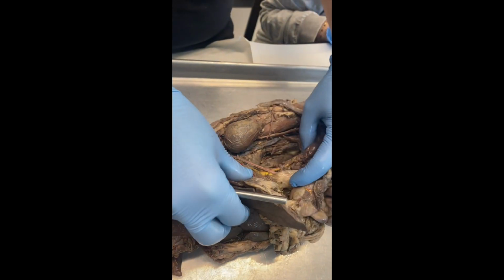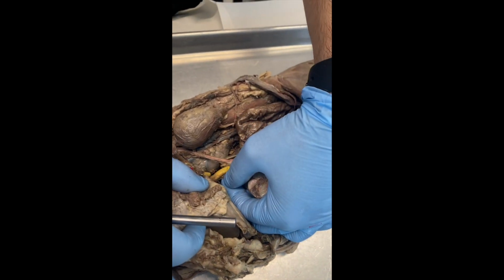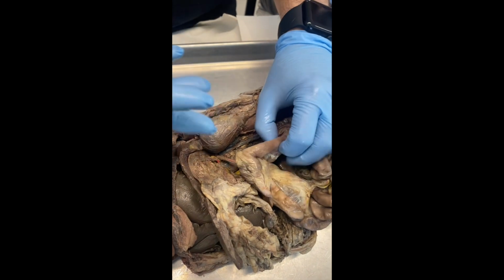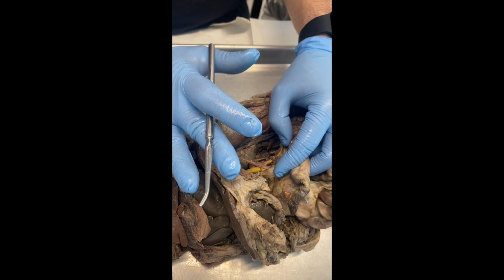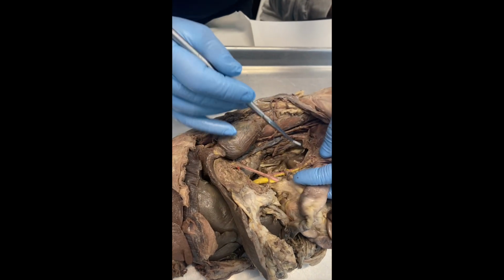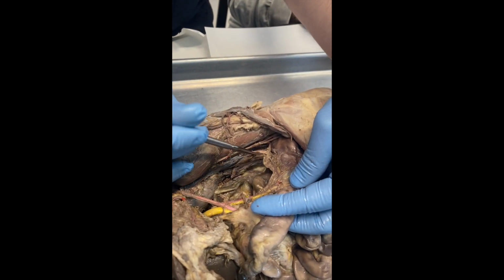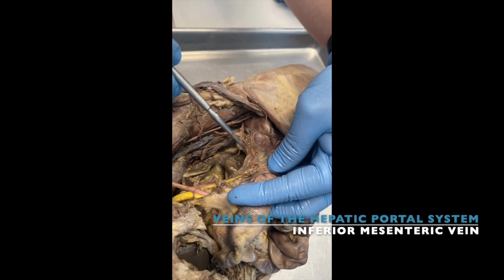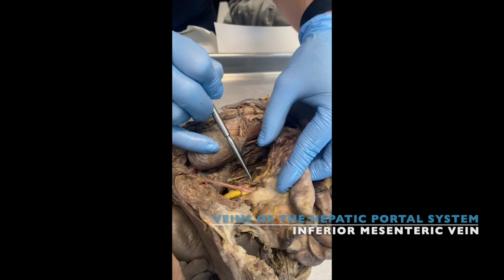The hepatic portal system. So let's look at these yellow veins. In this model, to make it easier for you to identify the hepatic portal system, they dyed them a different color. Okay, but they are all veins. They were dyed in yellow. If this is an inferior mesenteric artery, guess what's the name of this yellow vein? Inferior mesenteric vein. Exactly. So this is your inferior mesenteric vein.